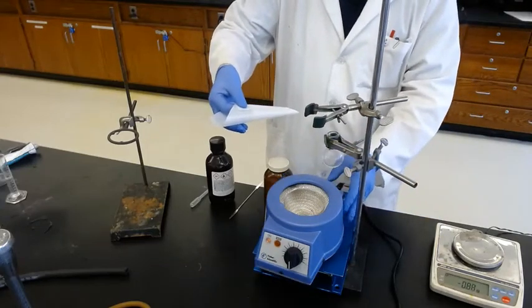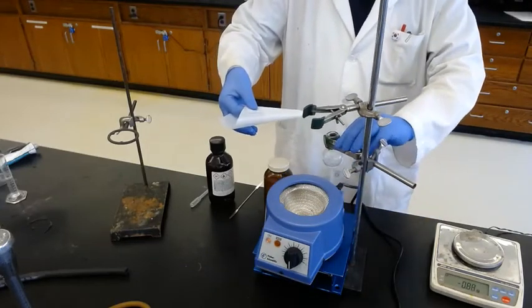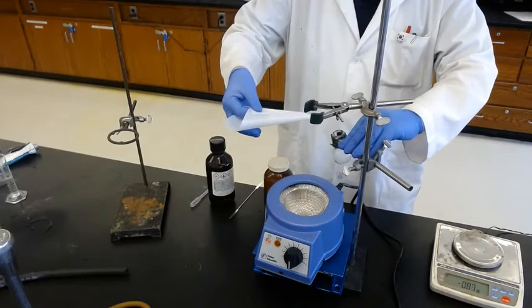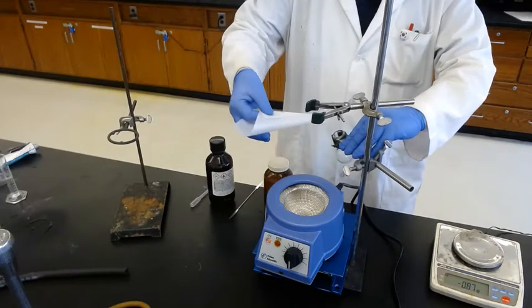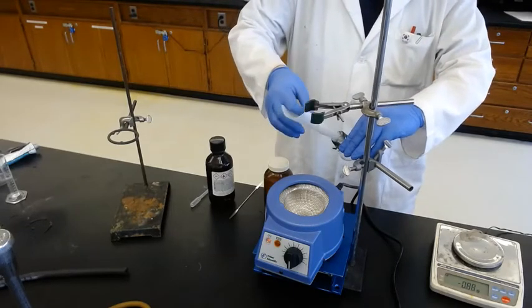Stay away from the heating mantle so you don't spill it. Make a cone with the paper and add the solid to the flask.